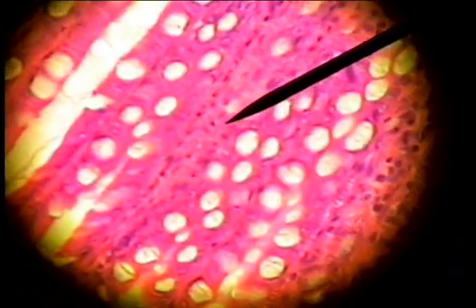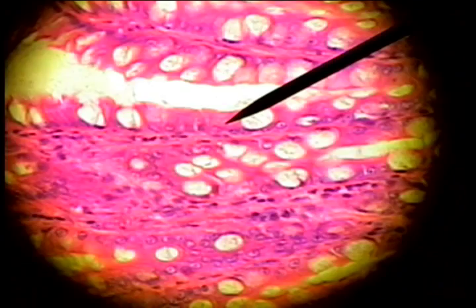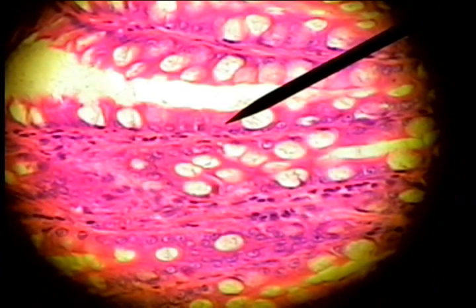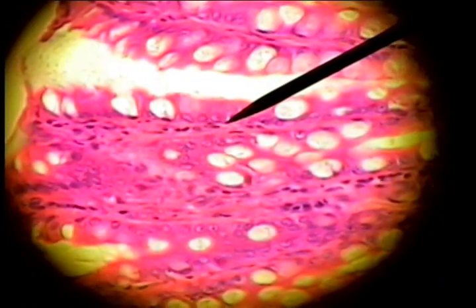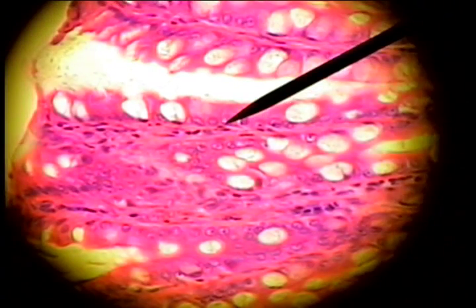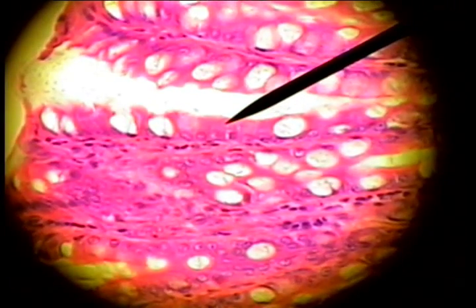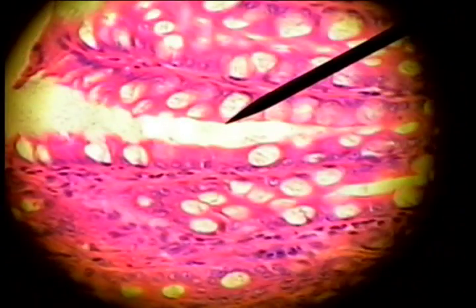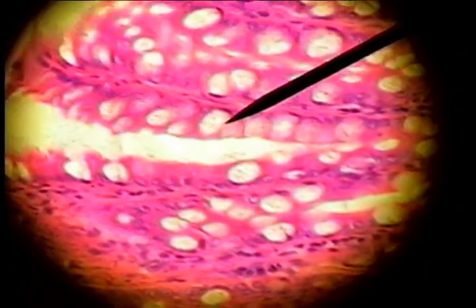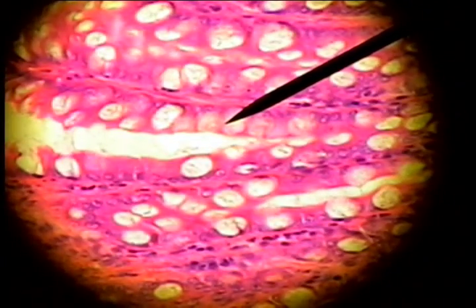The epithelium type is also characteristic of the digestive tract, and it's columnar. Here's the basement membrane. There's the nuclei, all in the same plane, taller cells than they are wide, but many, many goblet cells.